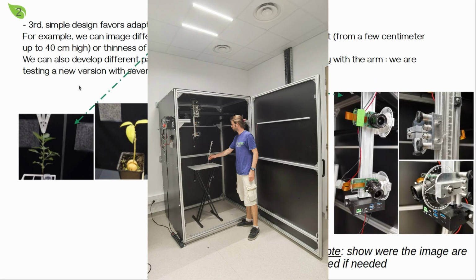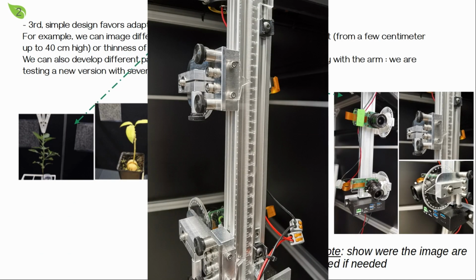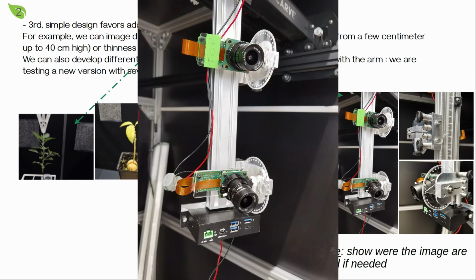Third, a simple design favors adaptability and evolvability. For example, we can image different plants with different architectures, different height from a few centimeters up to 40 centimeters high, or different thinness of their axis. We can also develop different parts of the robot separately, as we did recently with the arm. We are testing a new version with several Pi cameras.